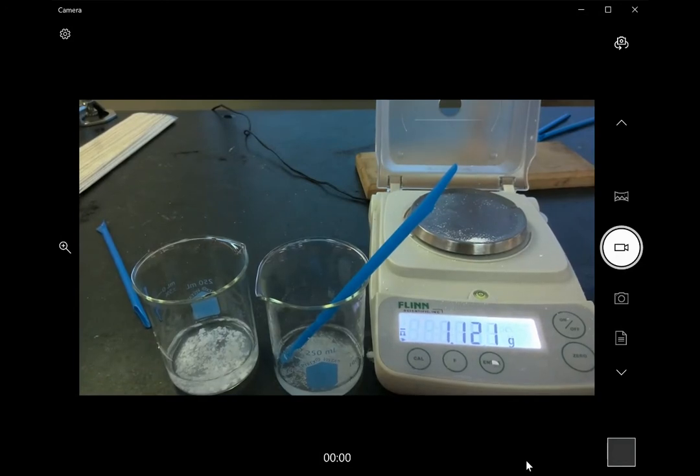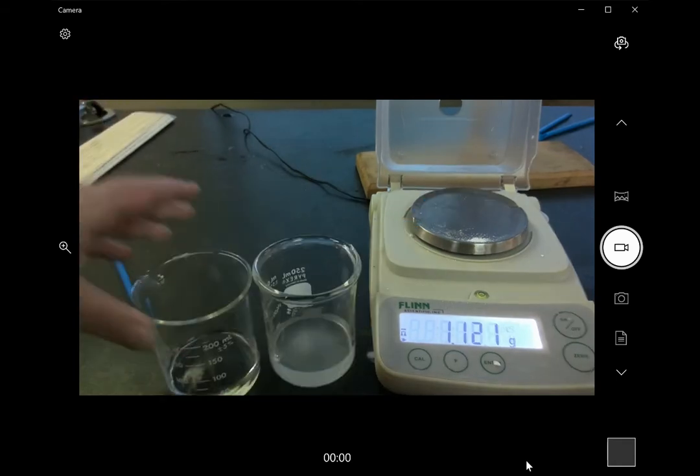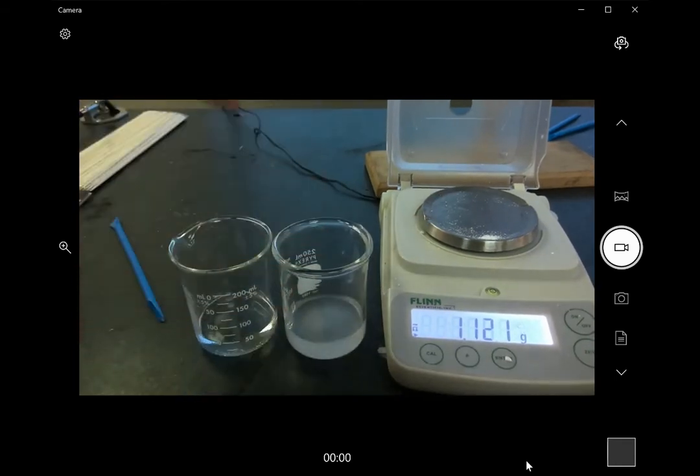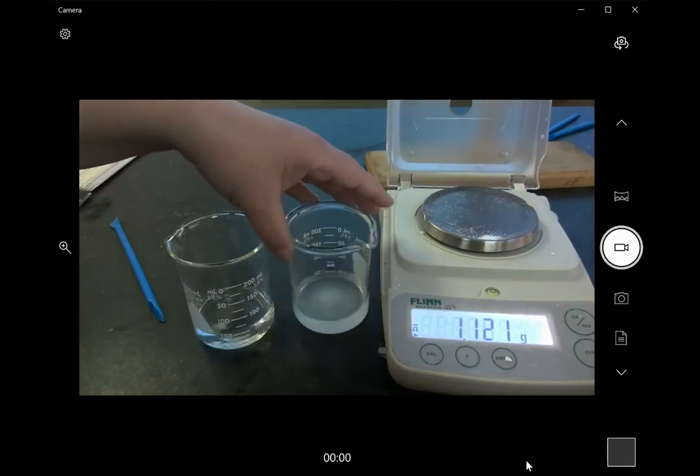And I'm going to let these dissolve. Okay, after a bit of stirring we get these solutions where they have completely dissolved, and I'm just going to pour one into the other.